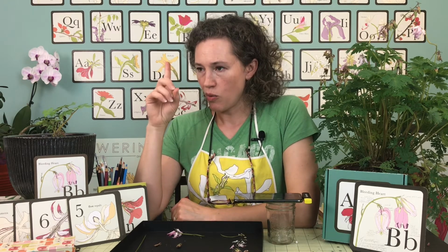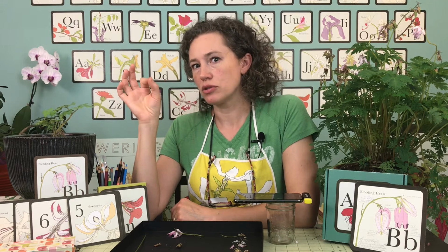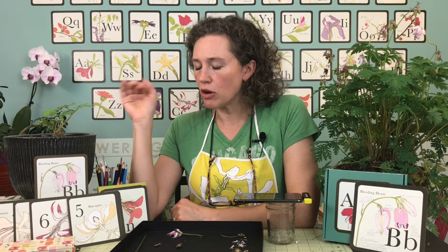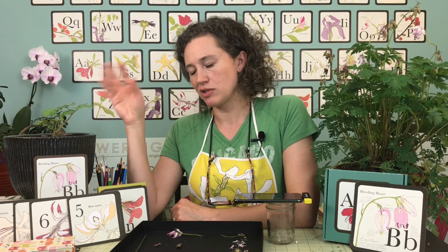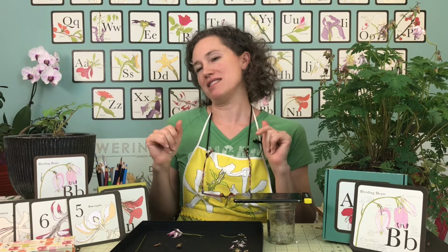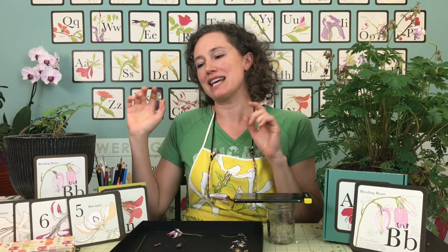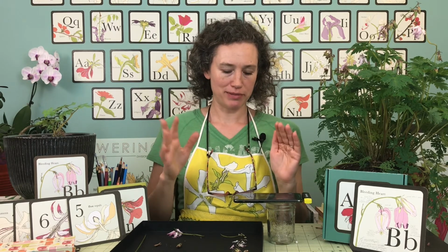However, what really makes a eudicot is that it has dicotyledons, seed leaves. So we know for sure that it's a eudicot, whether or not it has tepals or sepals and petals. So I'm going to put a poll on the Facebook page, and I'm going to let you tell me whether or not you think that this bleeding heart is rogue and it's a little different and exciting and it has tepals, or you think it's totally normal and it has sepals and petals.